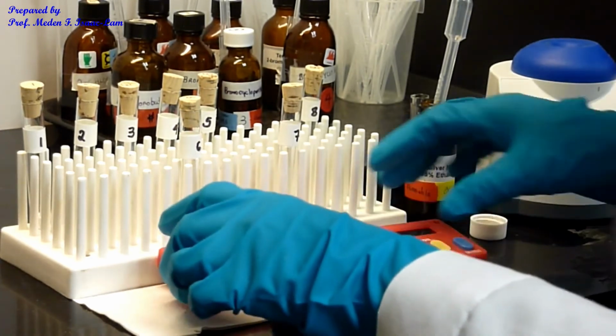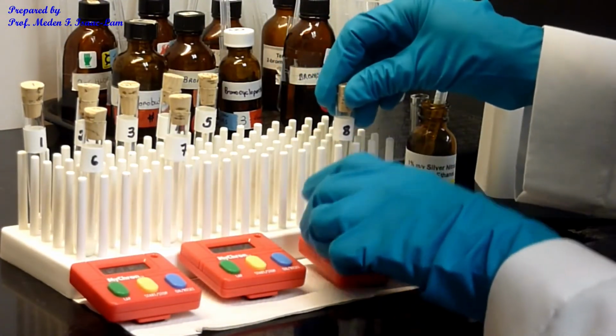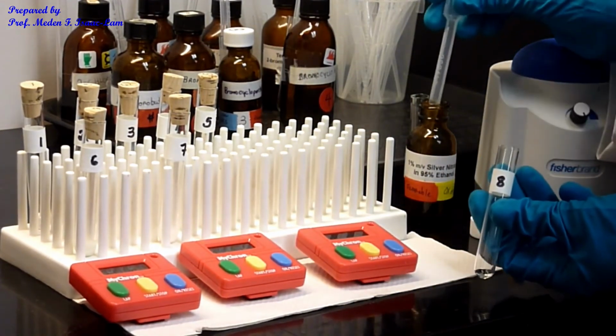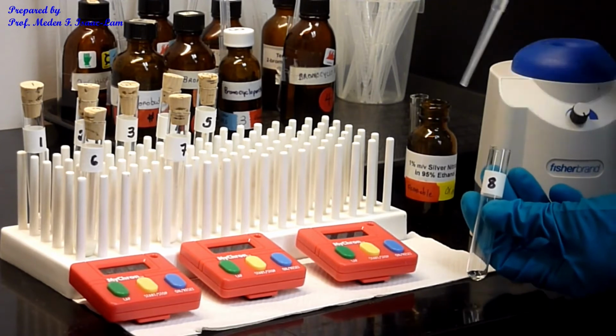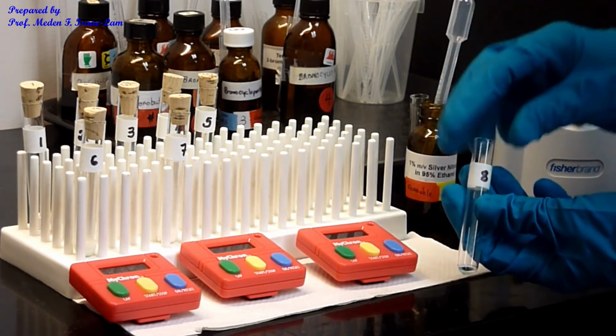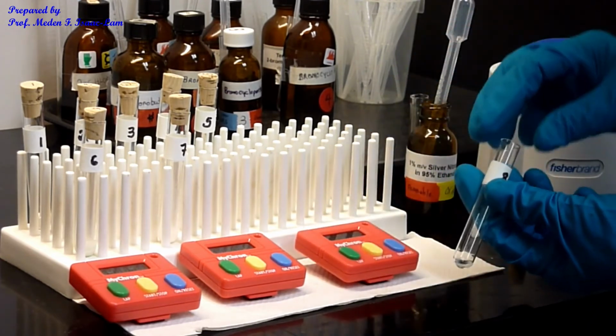Okay, so I'm going to do now, so this is 6, and that's 7, and number 8. Okay, so number 8. So let's do 1 drop. Okay, so see, okay, I've not even started it.